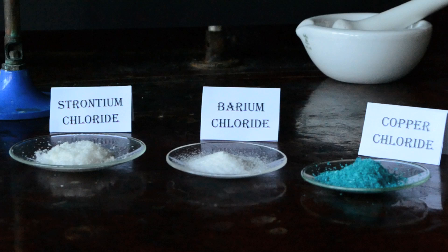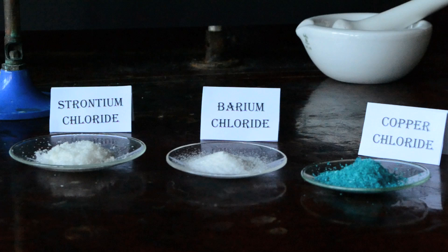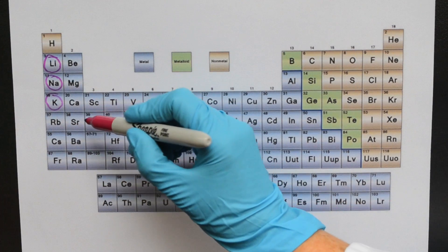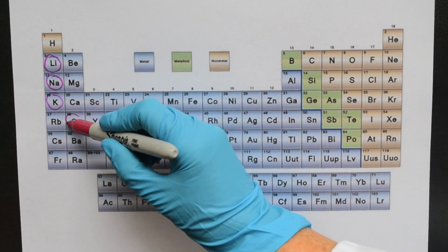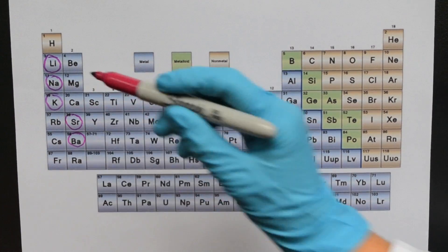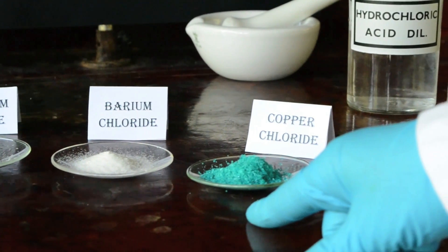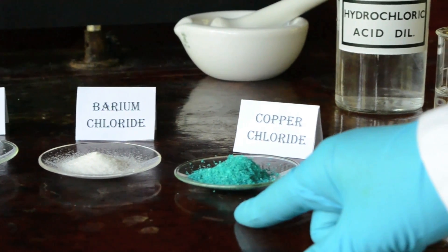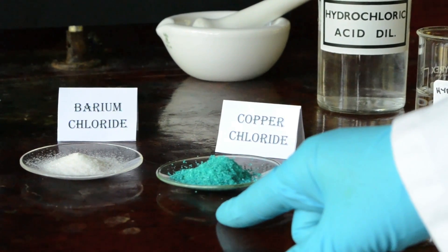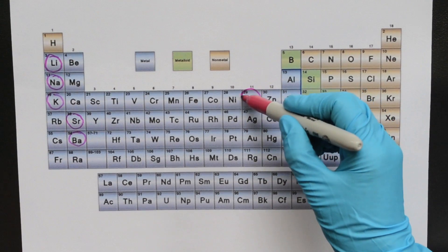Now we'll move on to the next two which are strontium chloride and barium chloride. These are members of group two of the periodic table — the alkaline earth metals. Finally we'll move on to copper chloride. This exhibits a very strong characteristic colour: blue-green. This is one of the transition metals.